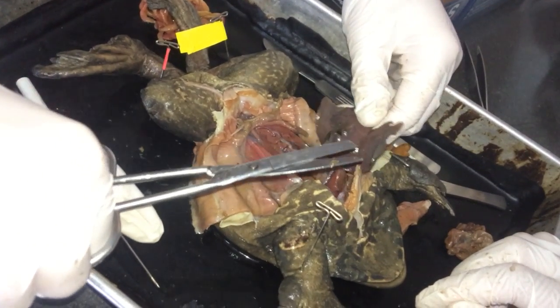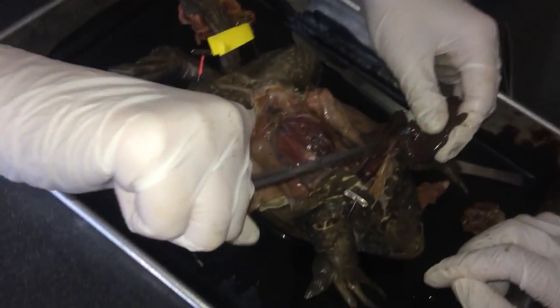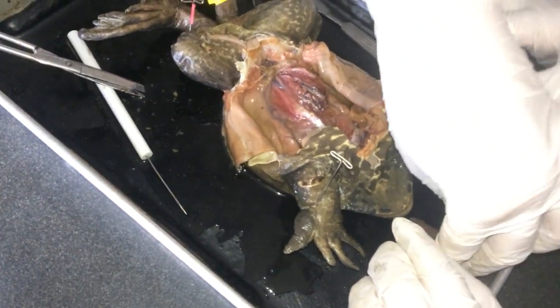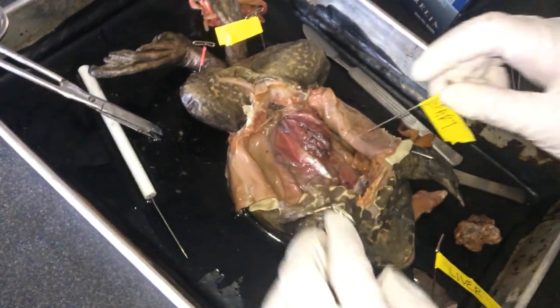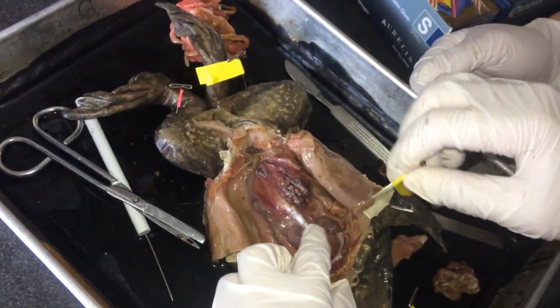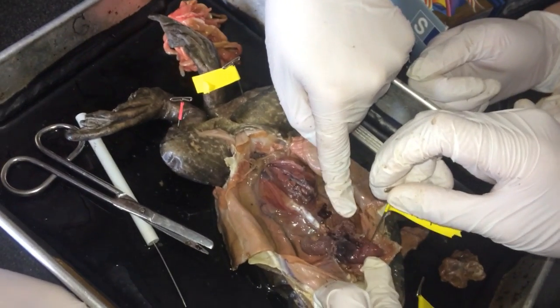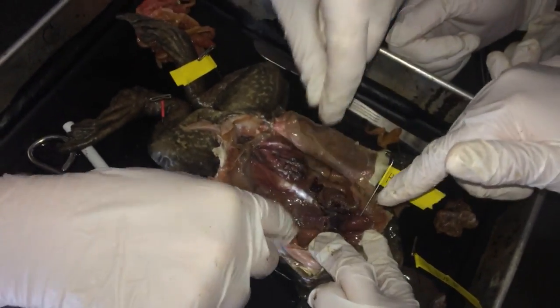I hope we weren't supposed to keep everything in the body. I don't think so. This is a liver. Do you have a liver thing? Heart. Do you have a heart? Heart. I think that might be an aorta? I think that might be it. Oh god. I think that's blood. This is a lung. Can I have a lung?